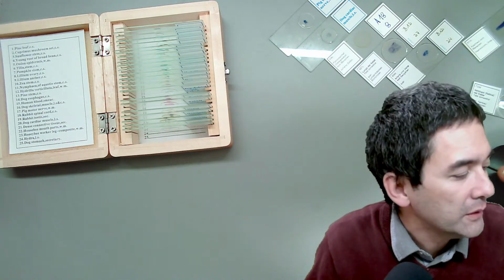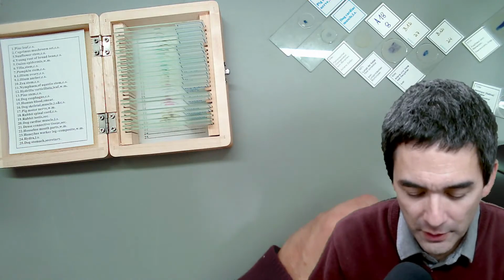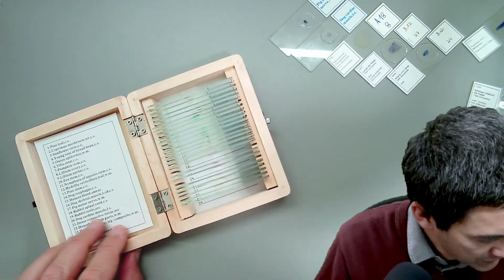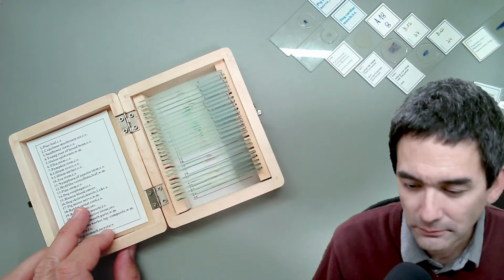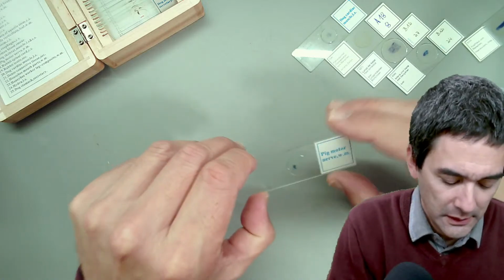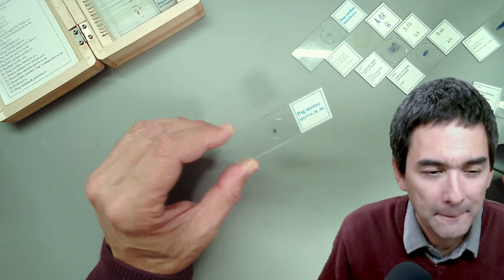I always have to go down a little bit with the magnification. What else do I have here? I'm already finished. Well, I do have a few others here as well. I mean, there are a few things. Pig, motor nerve. Yeah, I can show you some nerve cells over here. I'm not so happy with this slide here. That's why I put it away.